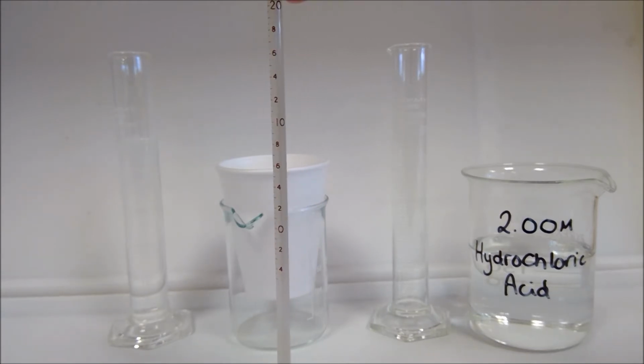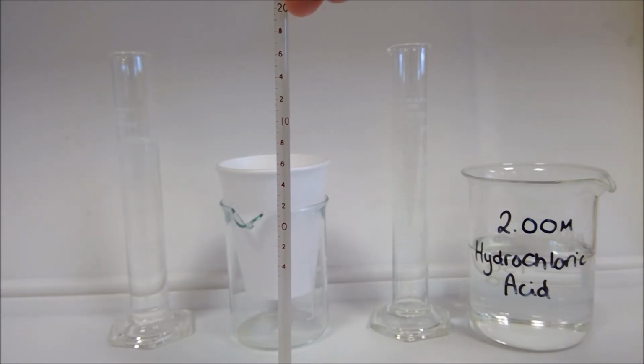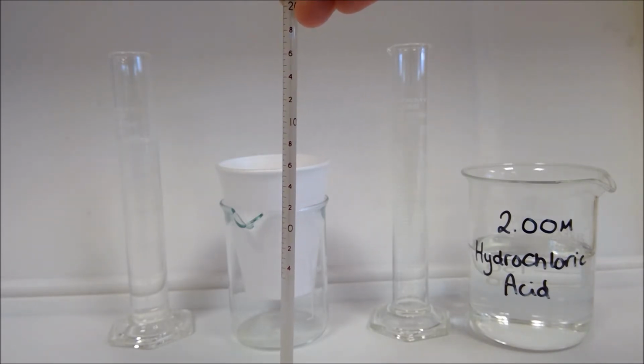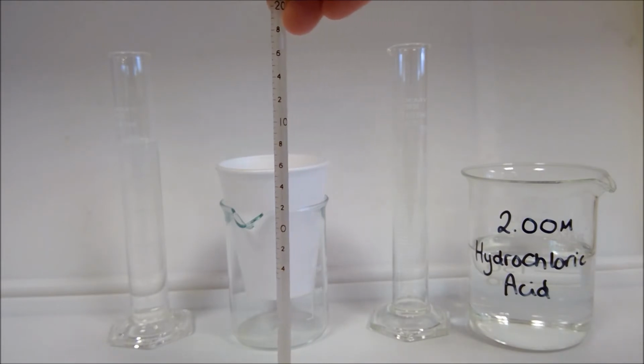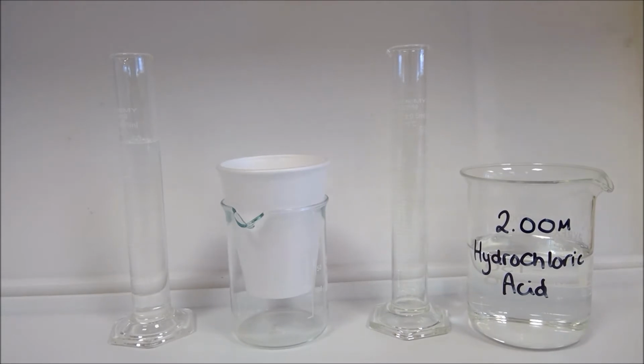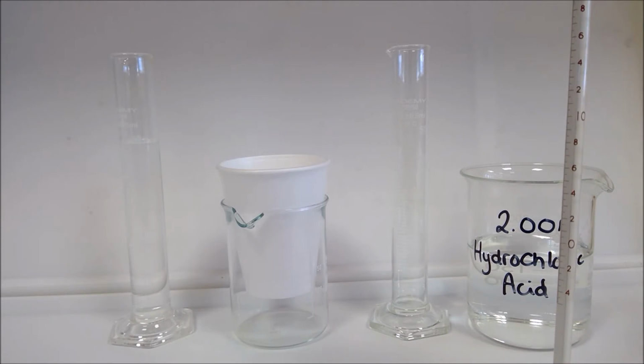So we're going to make sure we've got the temperatures of our acid and our alkali for our neutralisation here before mixing, and then monitor the thermometer and record the maximum temperature reached. What we're going to do is have a look at a series of different acids. So we're going to look at hydrochloric acid, nitric acid, and ethanoic acid. We're going to react all of those with sodium hydroxide in turn and calculate the enthalpy change for neutralisation for each.